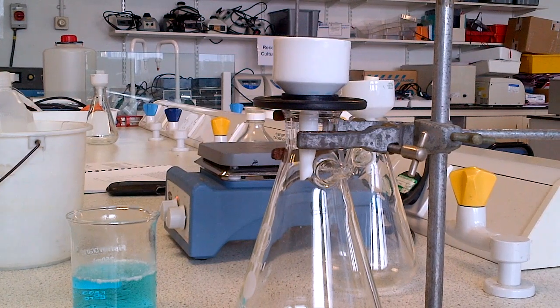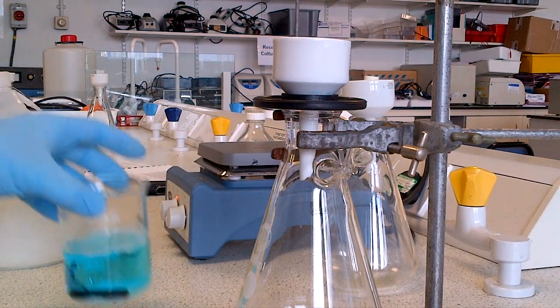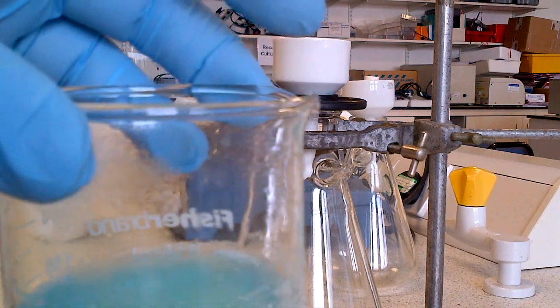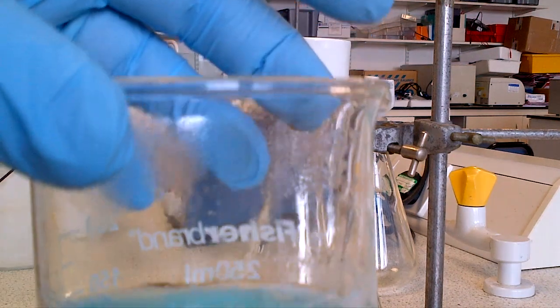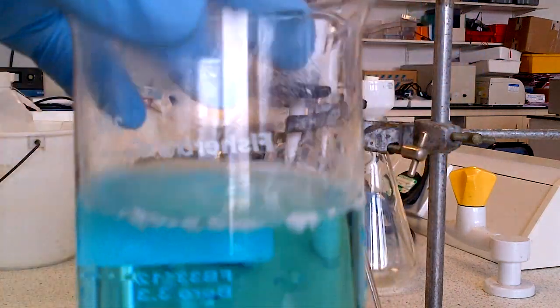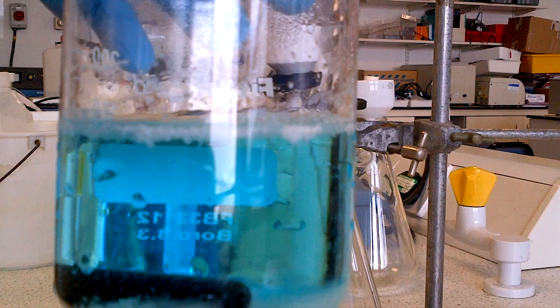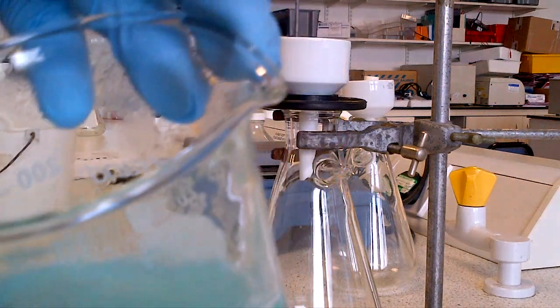After you've allowed the salicylic acid to spend about five minutes inside the chilled ice water, you'll see a further quantity of crystals appear in the solution. The crystals are now ready to be filtered out.